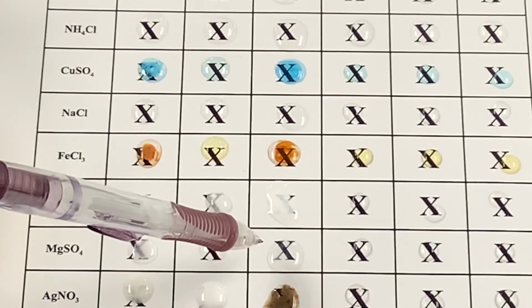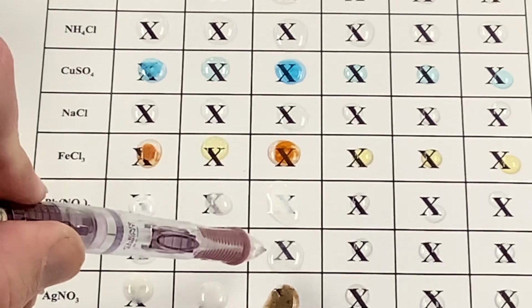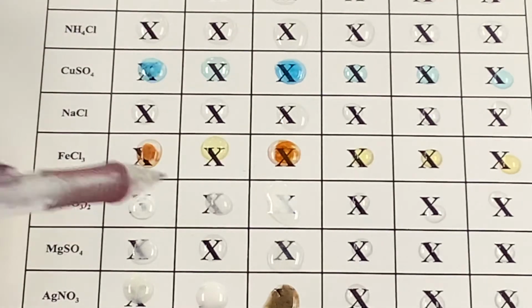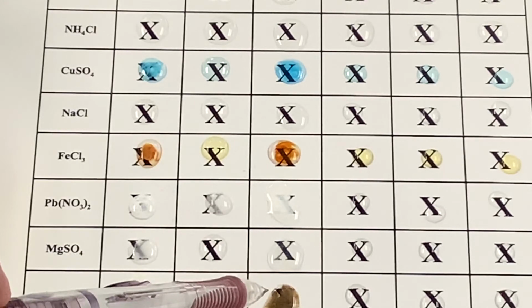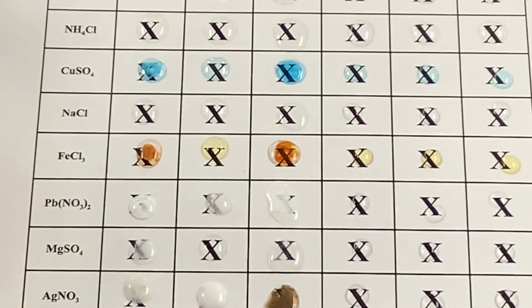This one looks pretty clear to me. Maybe a faint one. Yeah, there is a faint bit of precipitate popping up in the lower part of the X here. It would work better if I could get a stick out and stir all these, but we do have some faint going on there. Definitely this is a yes for the silver, and then the barium, this one is a no. I think the little bit that we're seeing here is sort of dripping down from that other one.